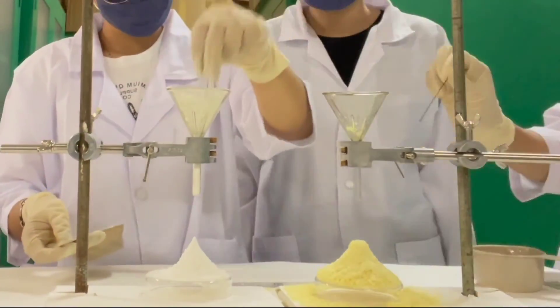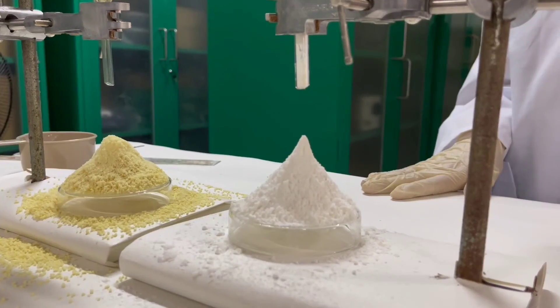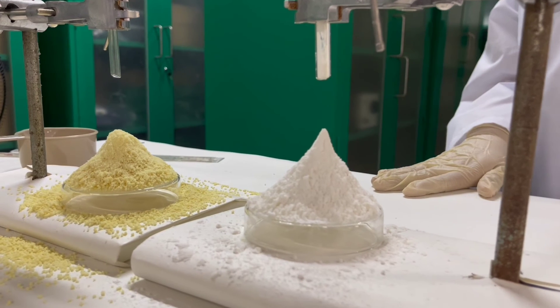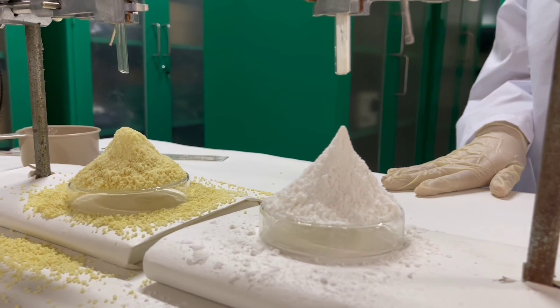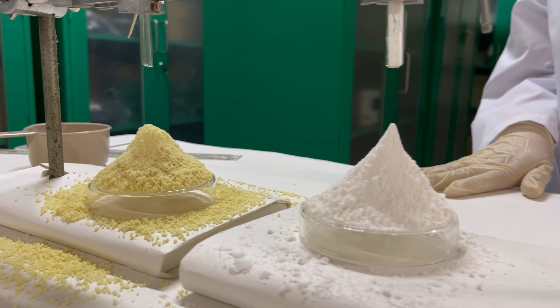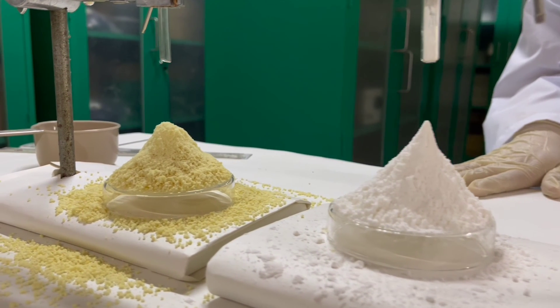Another observation we had is that it was hard for the powder to flow out of the funnel. Lastly, based on our calculations, the flow of the granules is considered fair and does not need any aid, while the powder has poor flow and needs to be agitated.